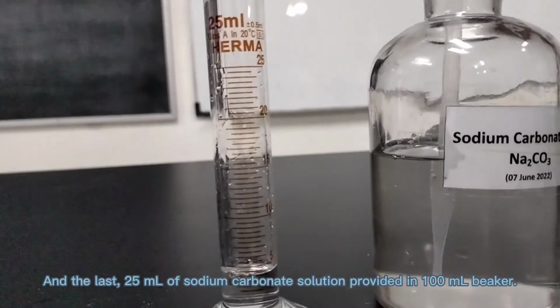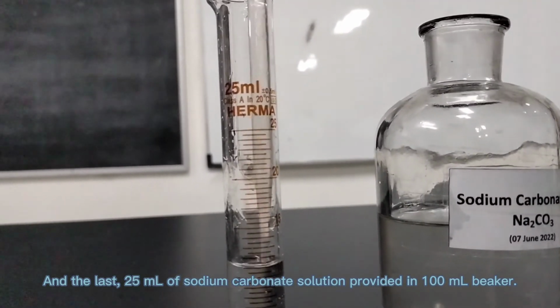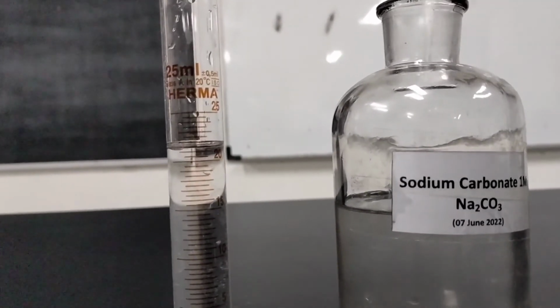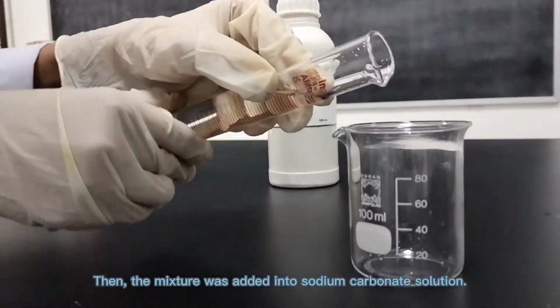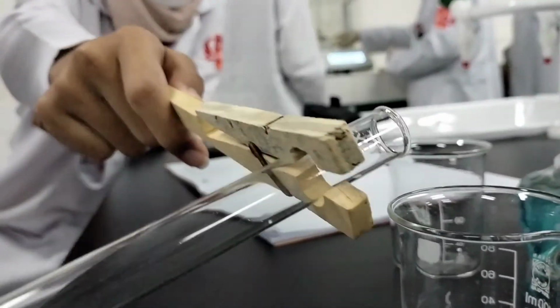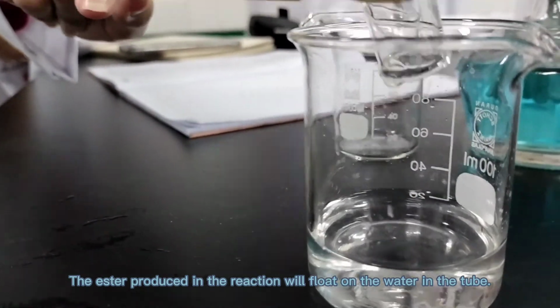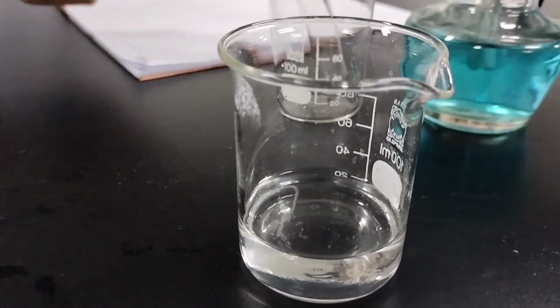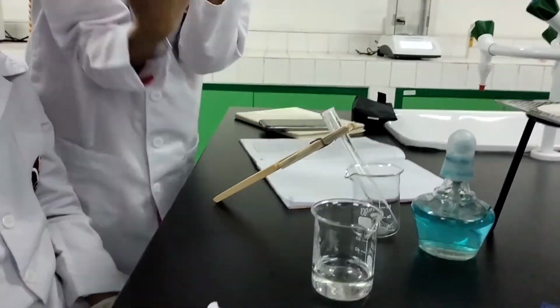And the last, 25 ml of sodium carbonate solution was provided in a 100 ml beaker. Then the mixture was added into the sodium carbonate solution. The ester produced in the reaction will float on the water in the tube. The odor of the ester was noted.